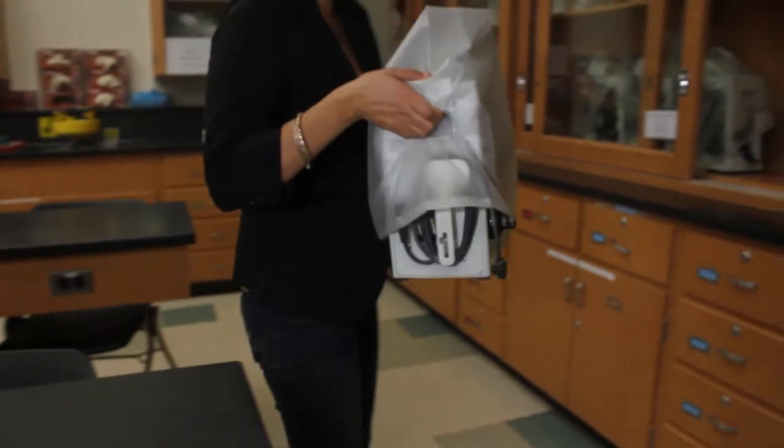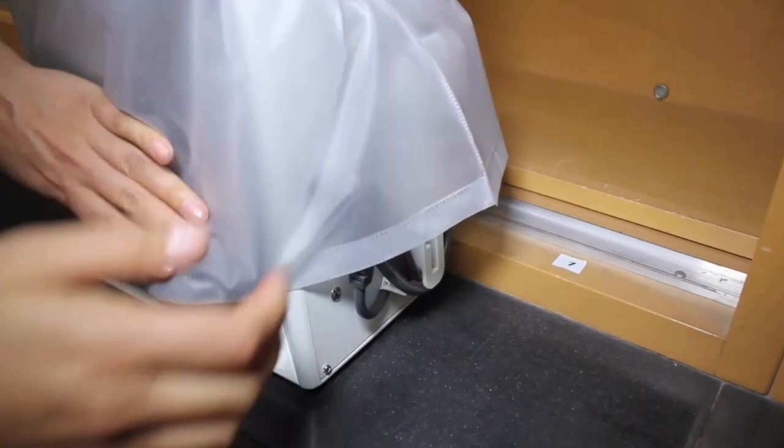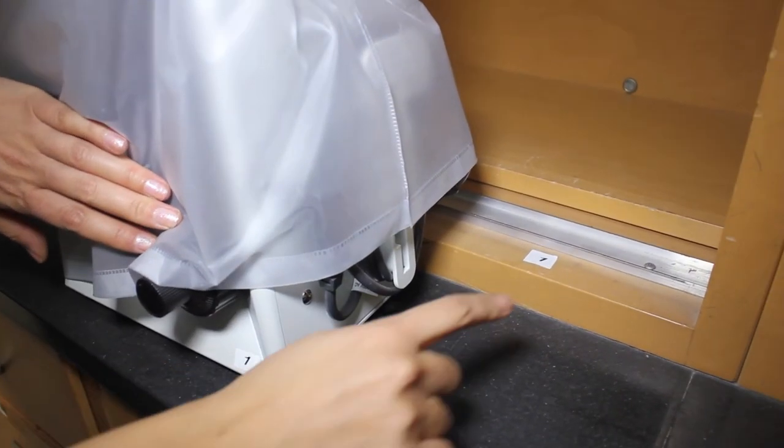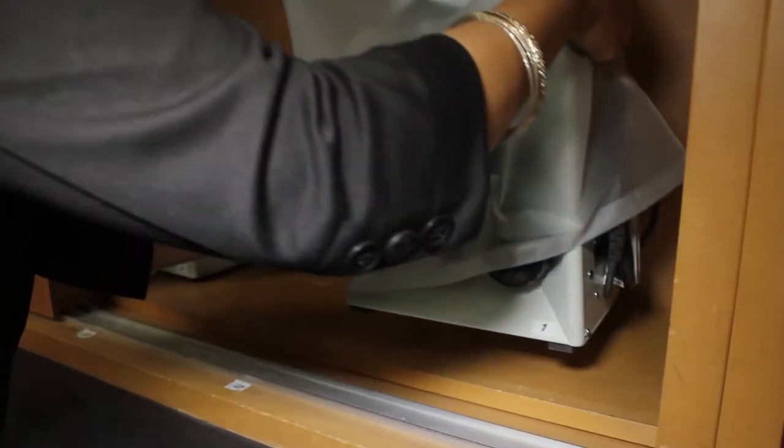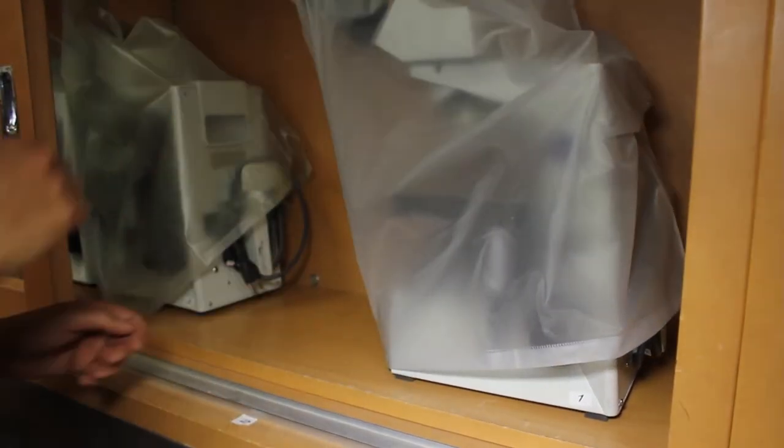Using two hands, carry the microscope back to the cabinet. Make sure you replace the microscope in the correctly numbered cabinet space by matching the number on the body of the microscope to the number on the cabinet.